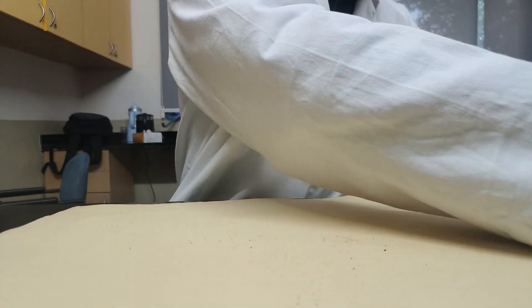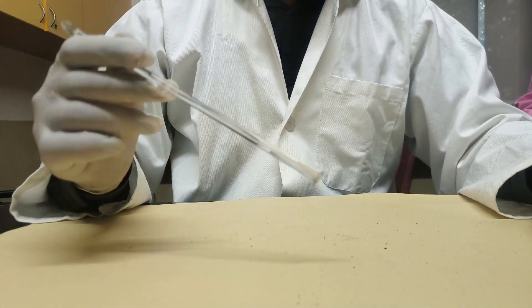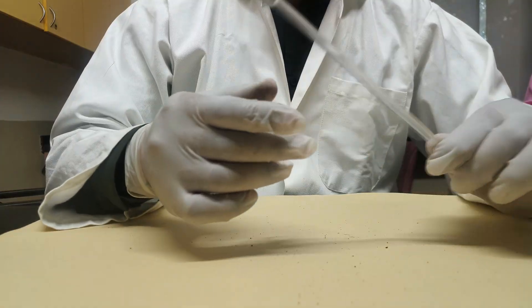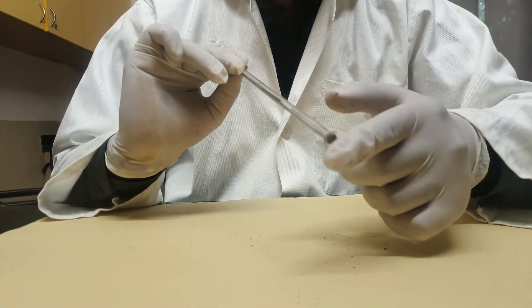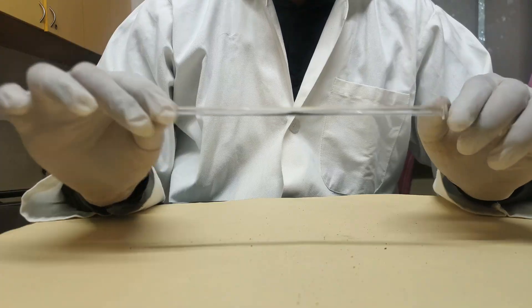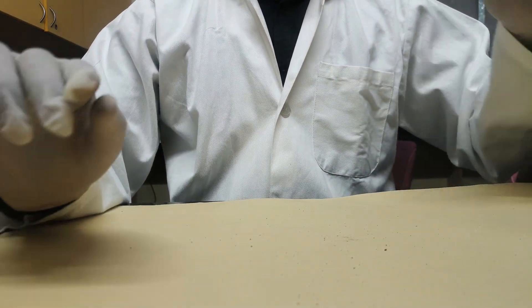Next item is the glass rod. It is made of glass and is used for stirring. Next is the mortar and pestle. It contains two parts: the top part is the holding part (pestle), and the bottom part (mortar) is used to crush salts inside the solution while dissolving.